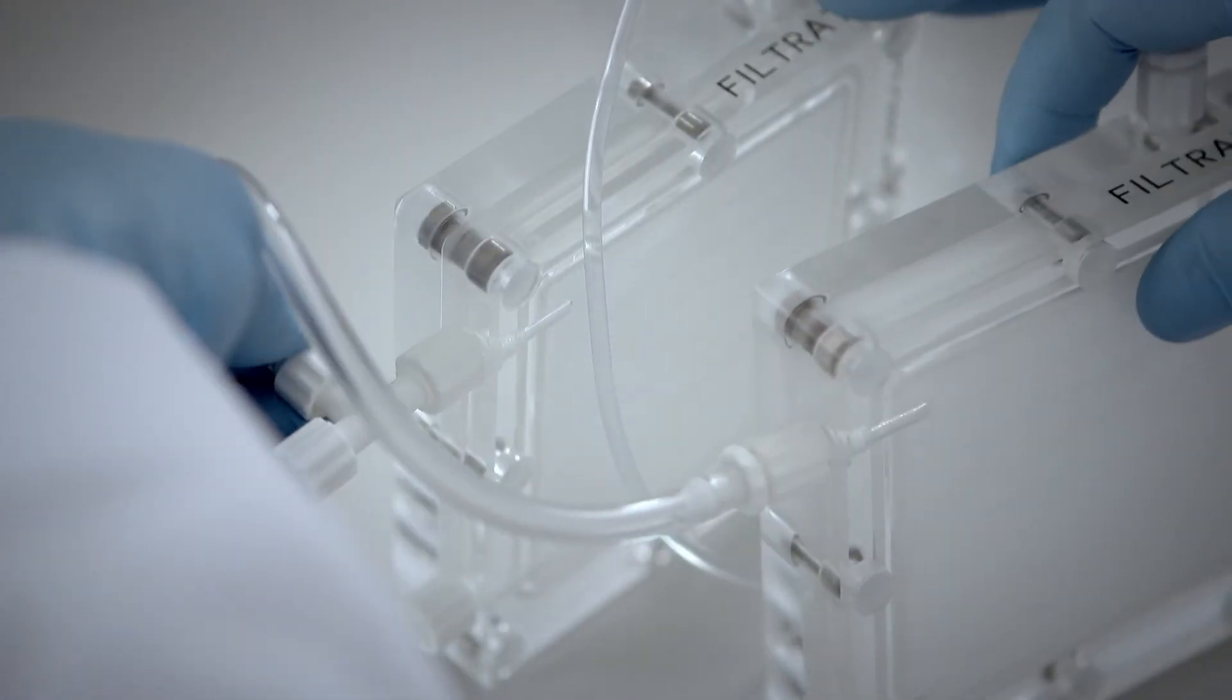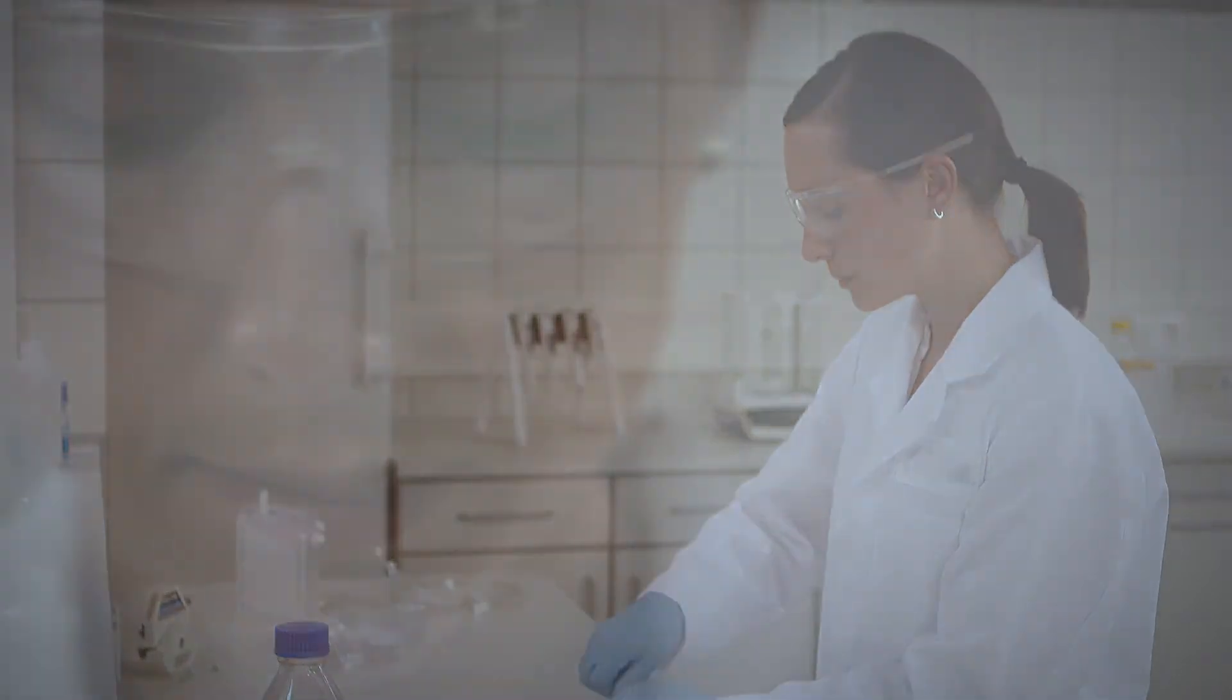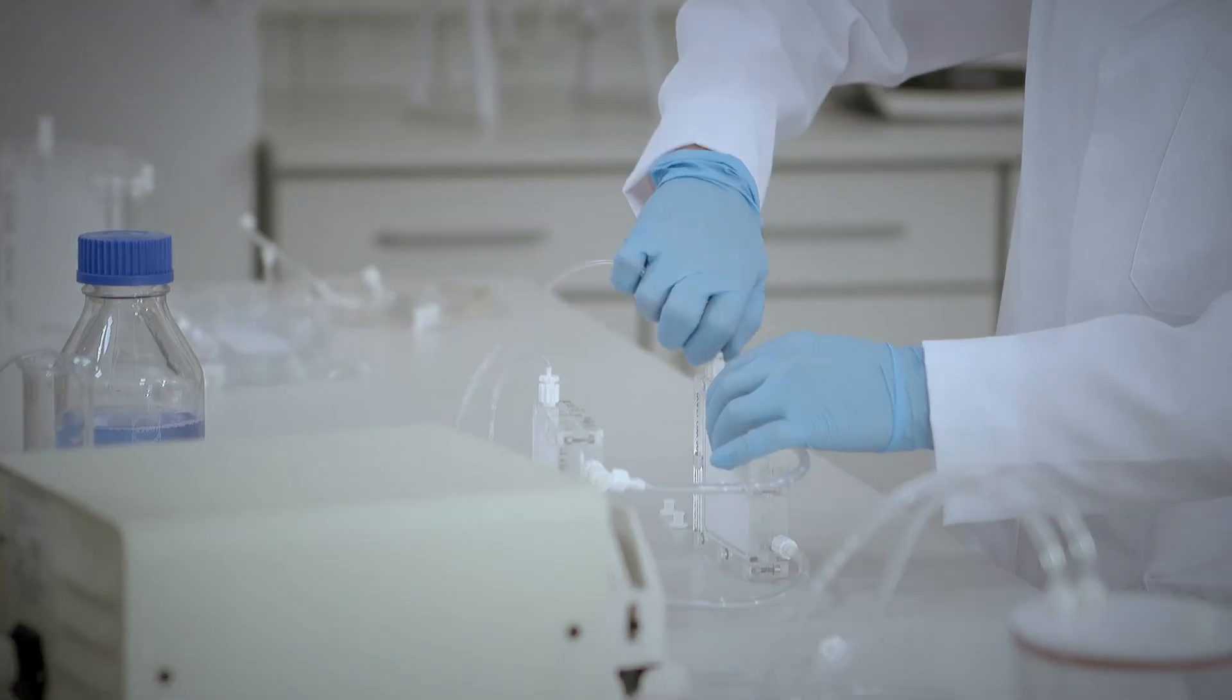Before you proceed to concentrate your sample, first connect a tube using the luer lock fitting to the filtrate outlet on the second VivaFlow 50R unit recently added.